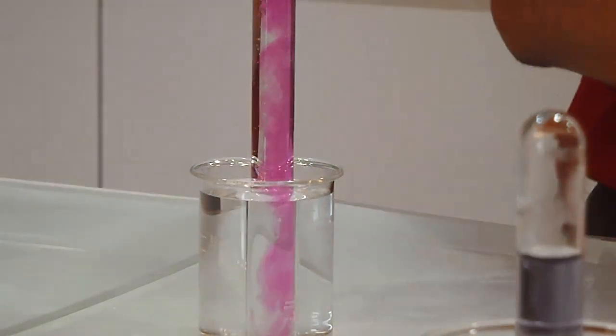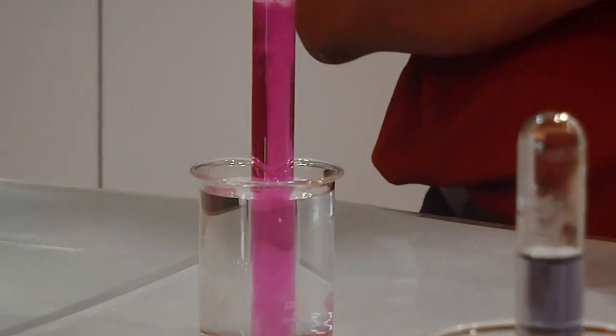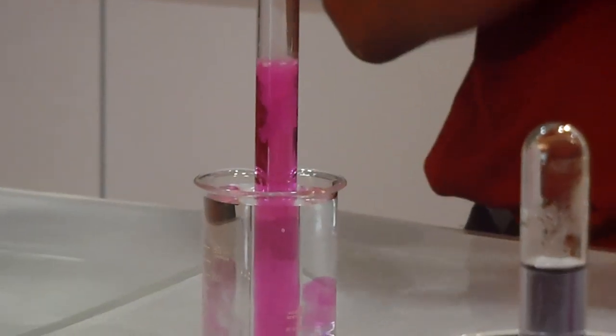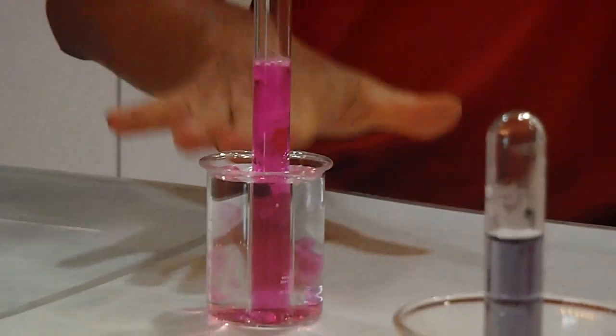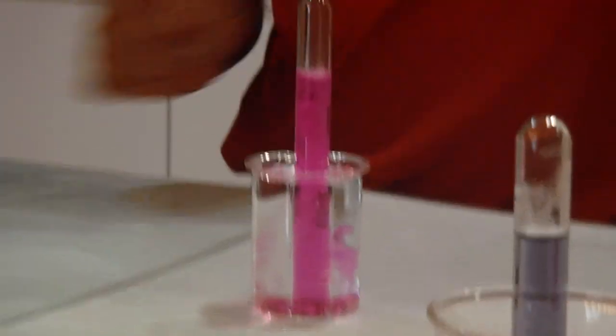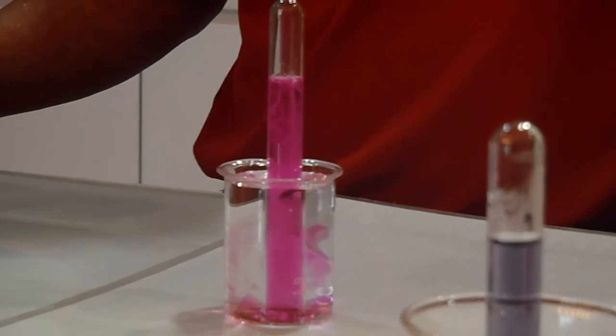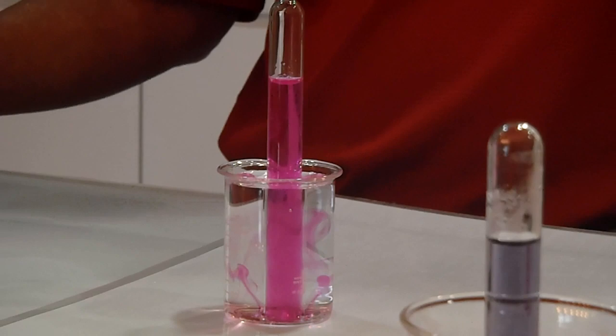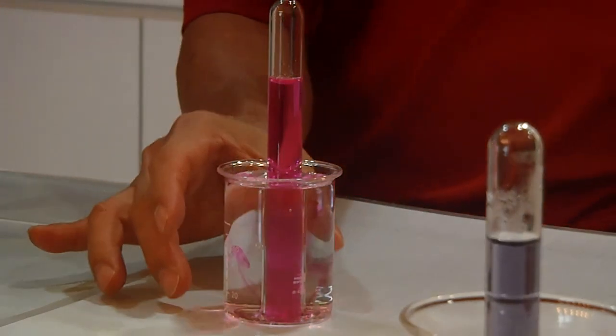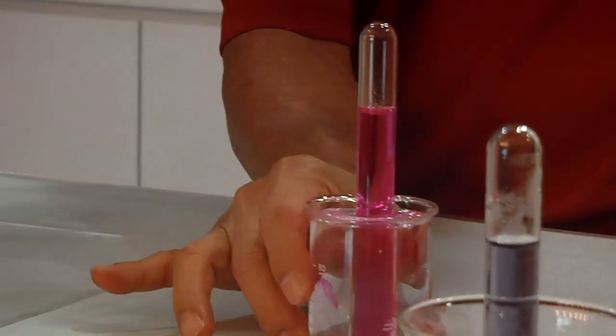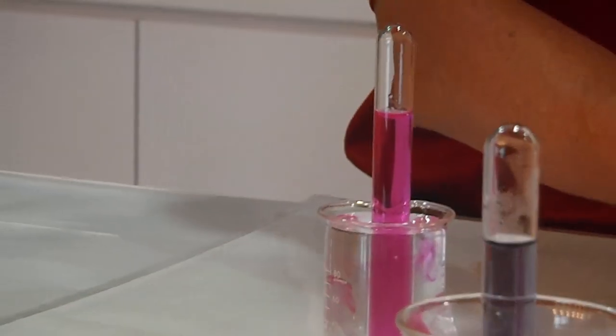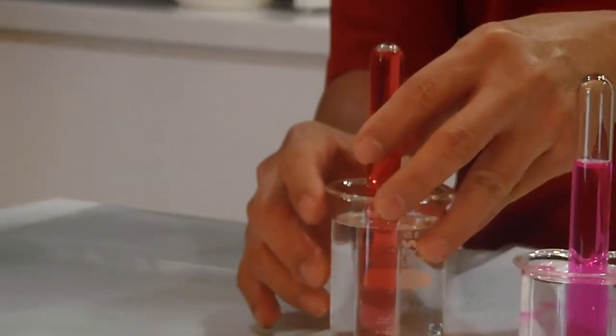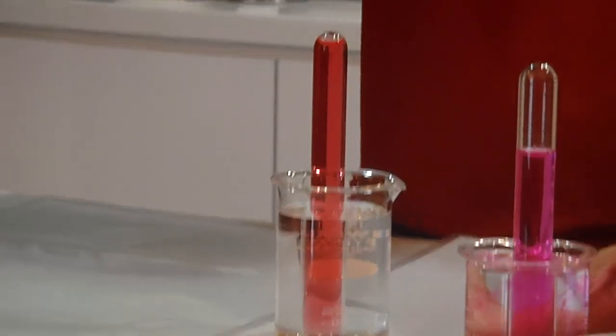Wow! Can you see? Magic. So you have got one here. Now, then this one is what color? What color is this? Green. This color is red. Okay. So let's see.